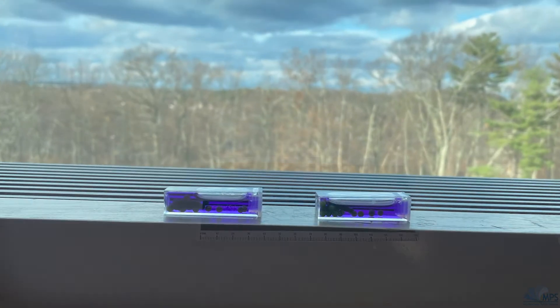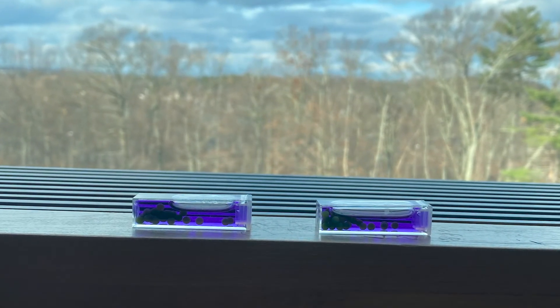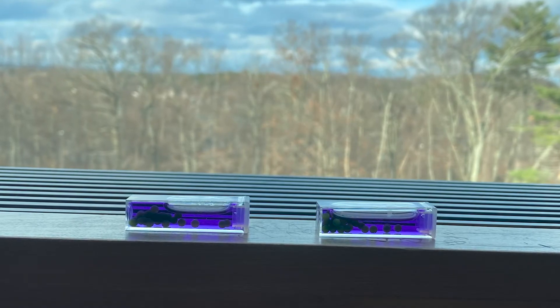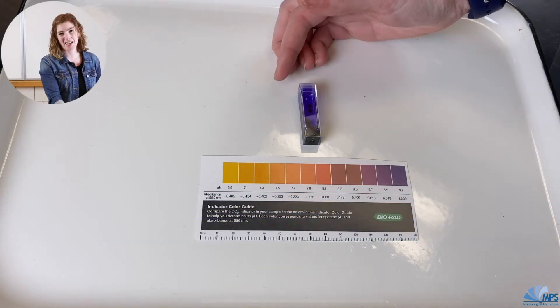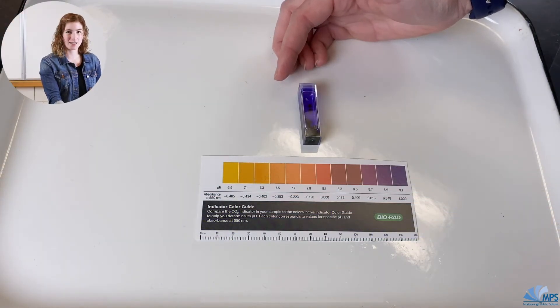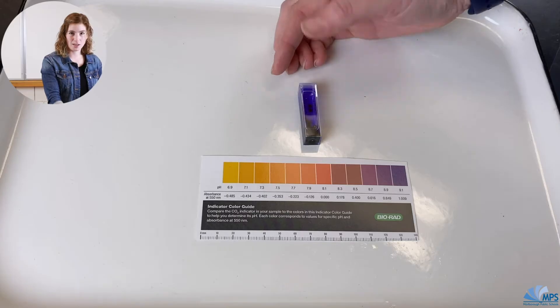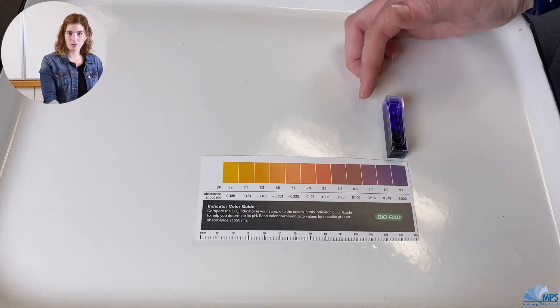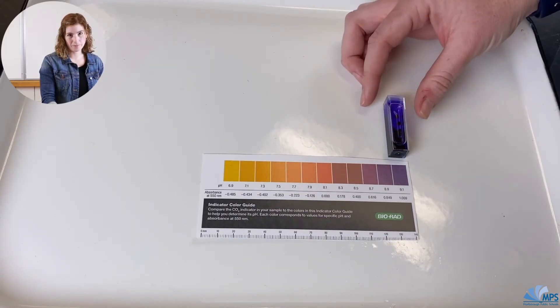My last light condition was natural sunlight sitting in the window, and this gives me pretty much the same results as the white lamp and the red lamp. It wasn't even that sunny today, but it still got enough natural sunlight for photosynthesis to take over, so my pH for the natural sunlight window condition is still 9.1.